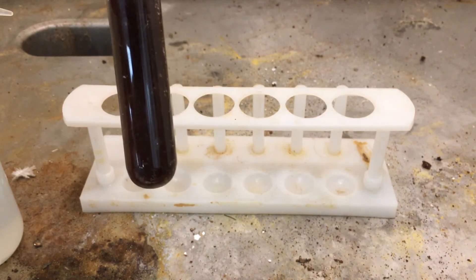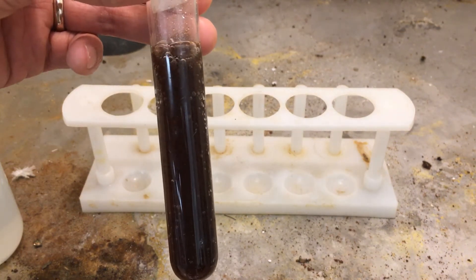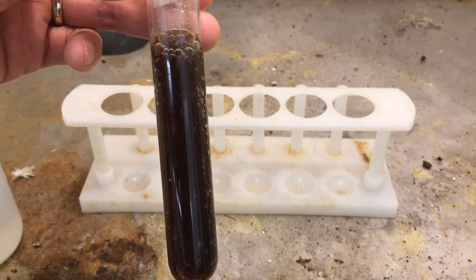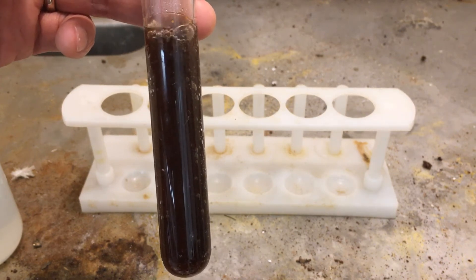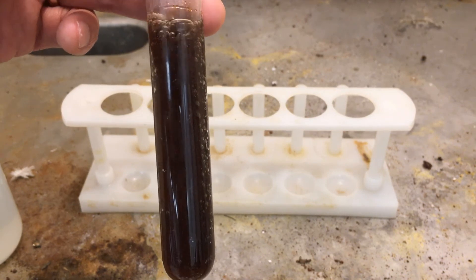Again, iron plus 3 is also a transition metal ion that gets complexed by water in a very similar fashion. But you definitely see the different colors—it was just iron 2 and now it's a much deeper color for iron 3.